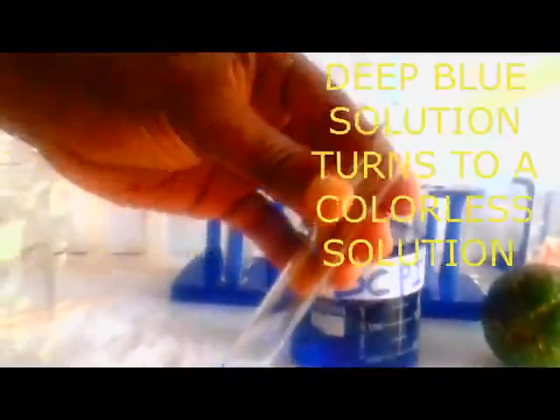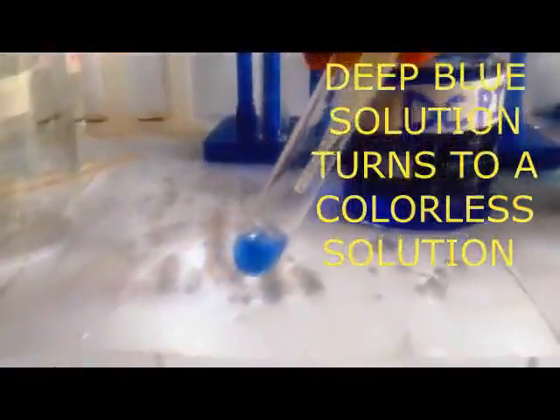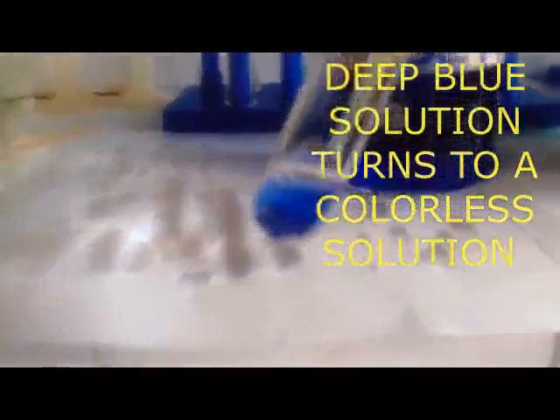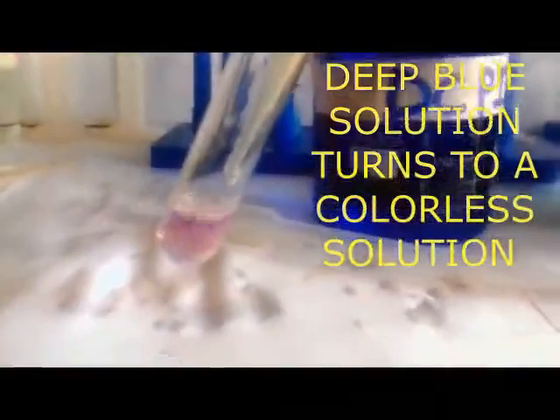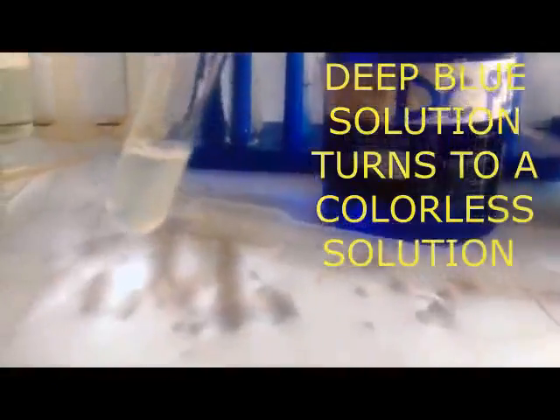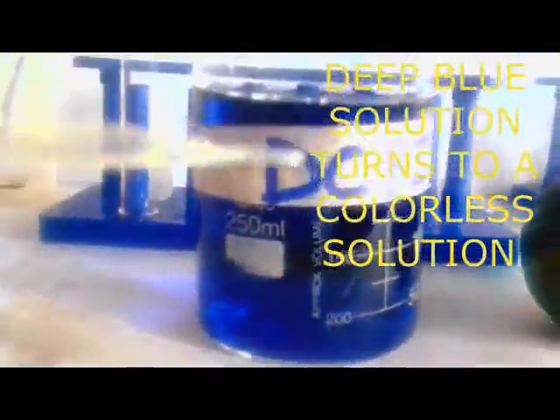Then I'm going to transfer drops of this juice. Now I put my drops of test solution. You can see as I'm putting now, the deep blue is disappearing. There we go. You can see that now our deep blue solution of the DCPIP is being decolorized.